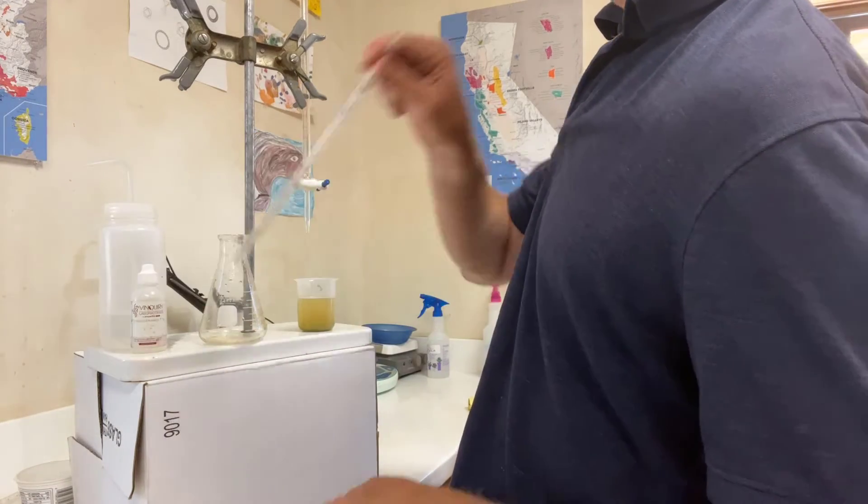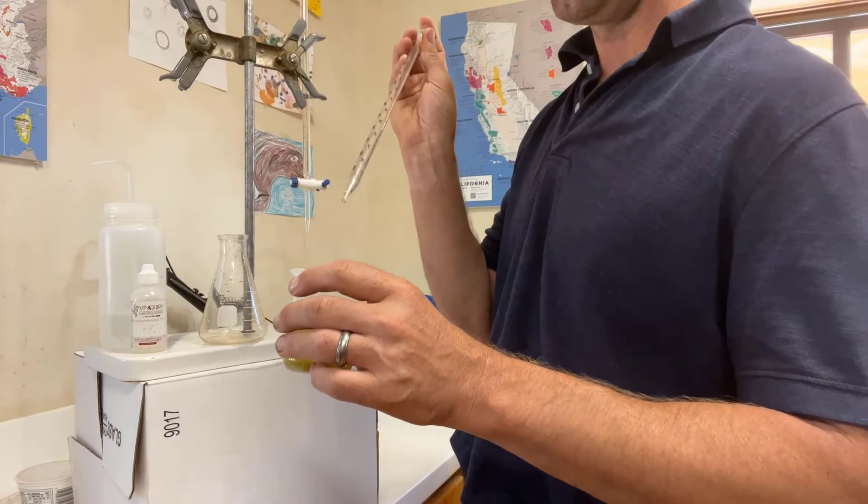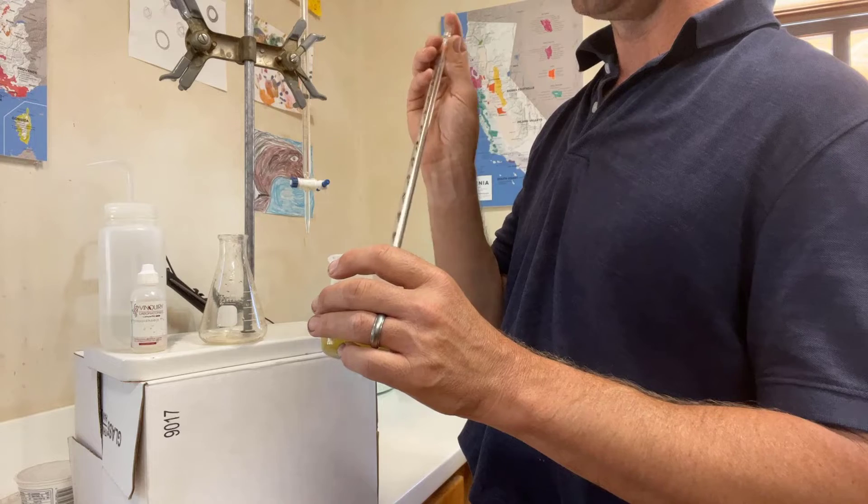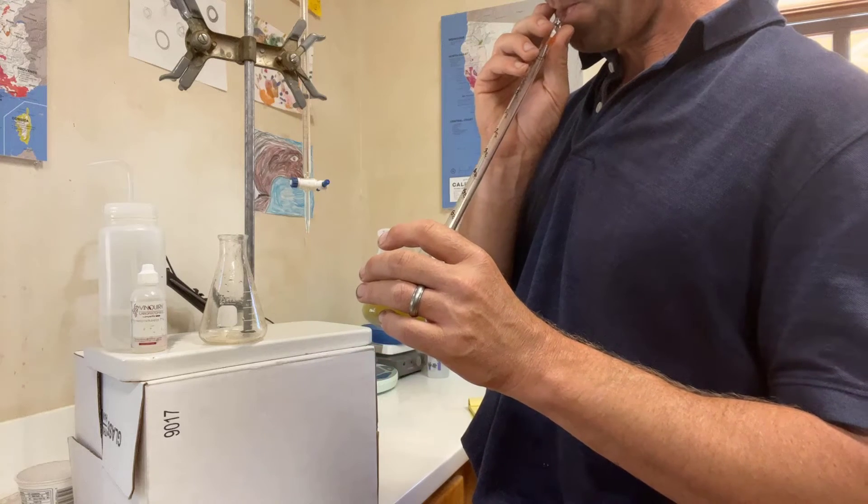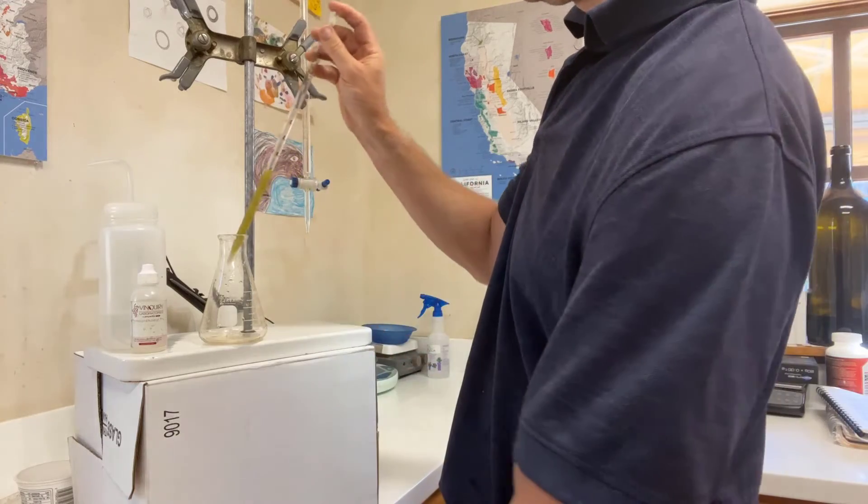Okay. So I'm going to take the pipette, deliver five millimeters—five milliliters—juice sample, into the flask.